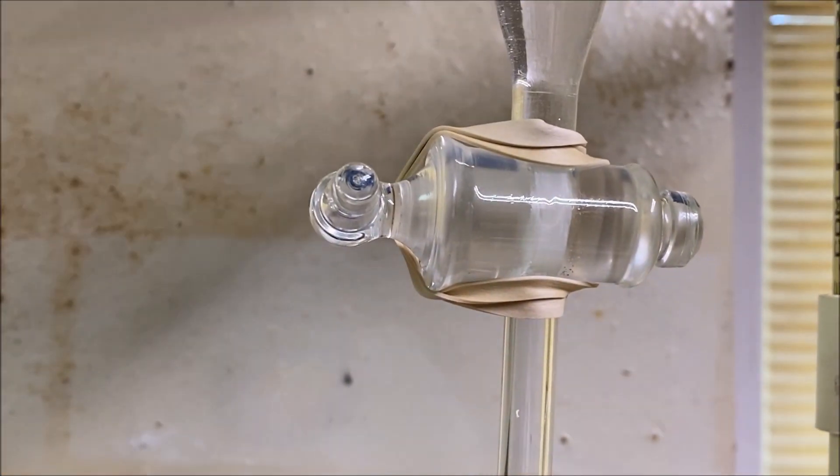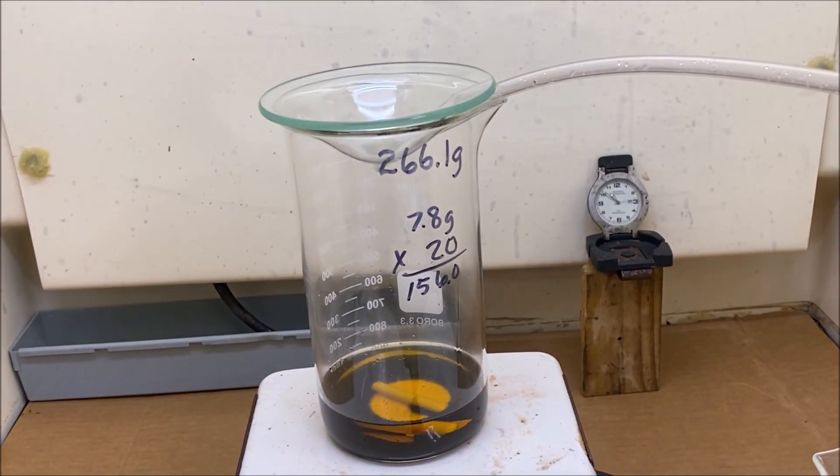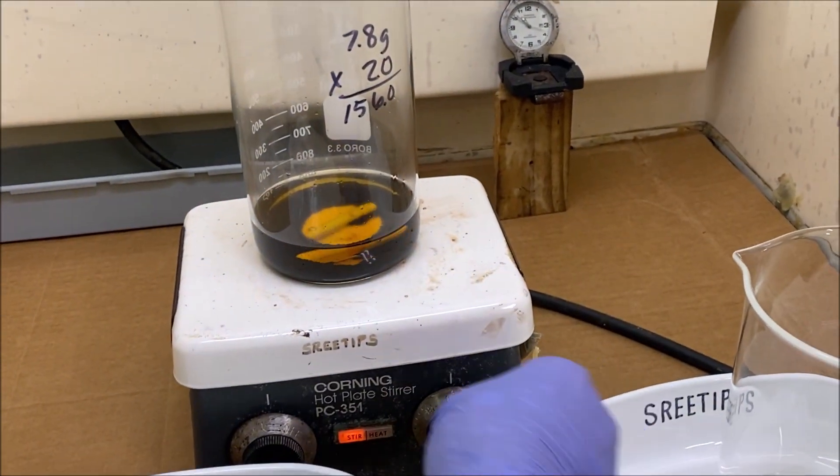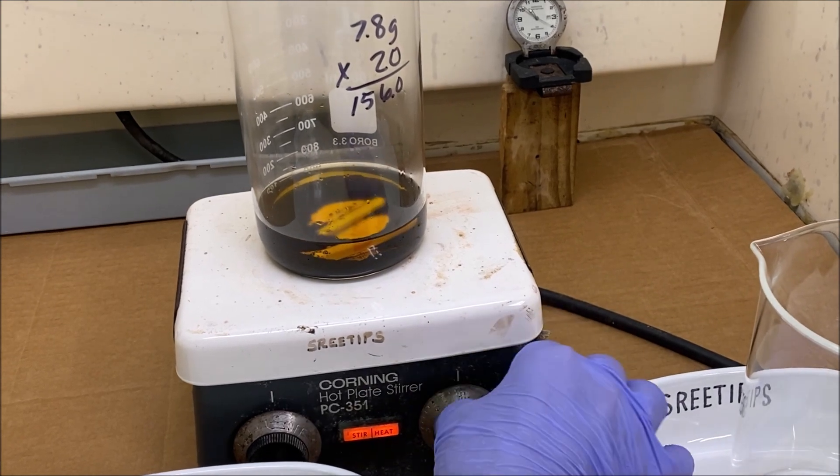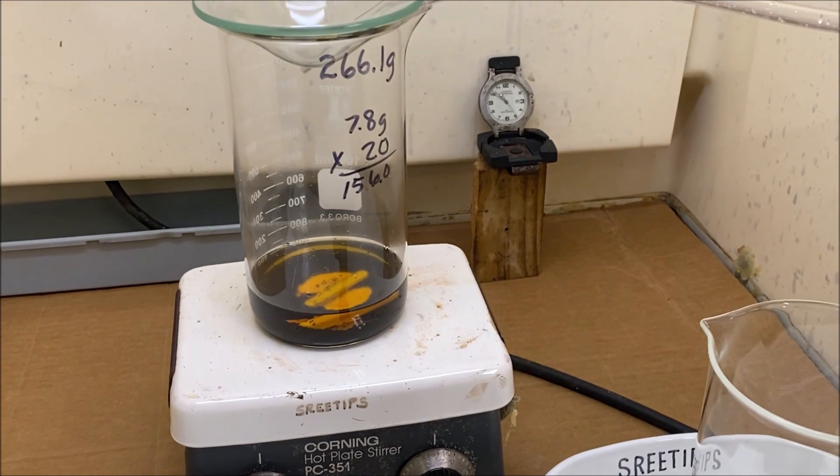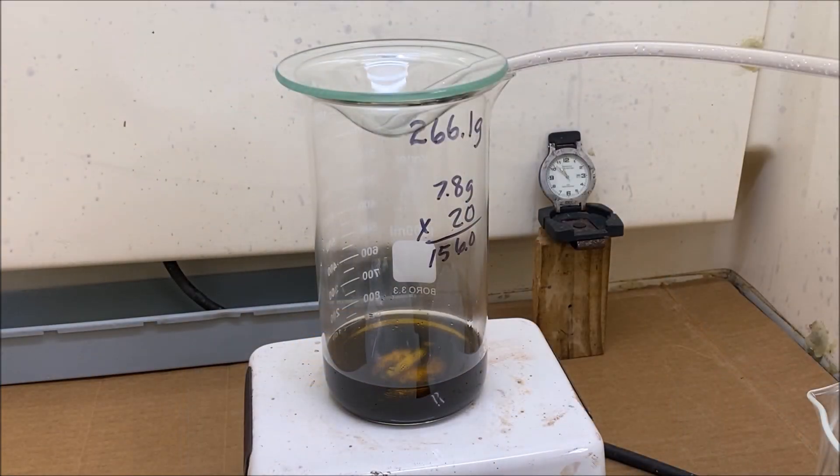Now what I'll do is I'll open this valve and we'll start dripping hydrogen peroxide down into our beaker. We're going to use hydrogen peroxide this time instead of nitric acid to dissolve the mixed black PGM powders. I'm initiating the trickle drop by drop of hydrogen peroxide.